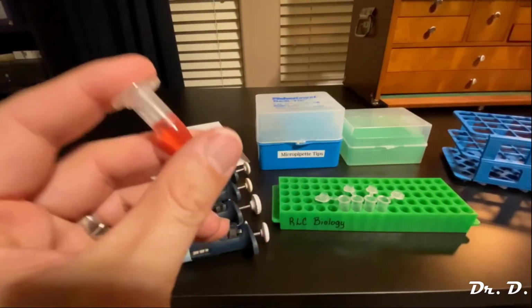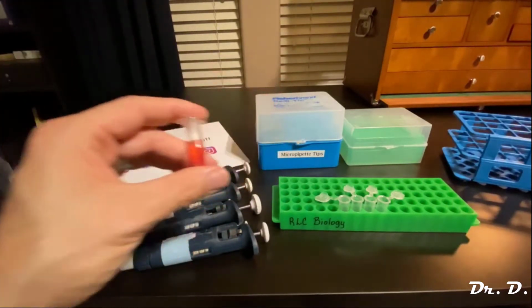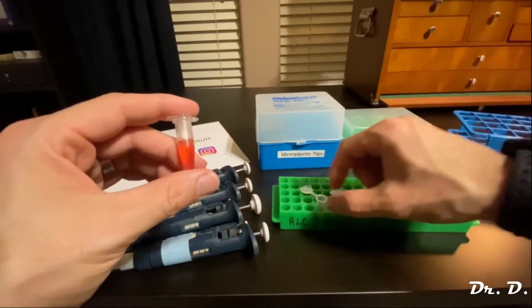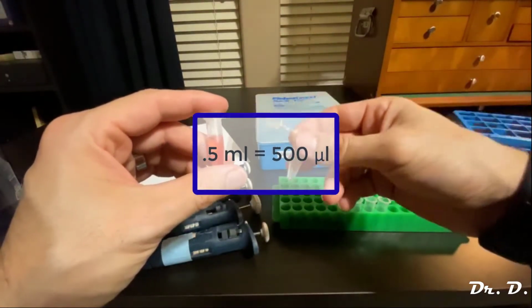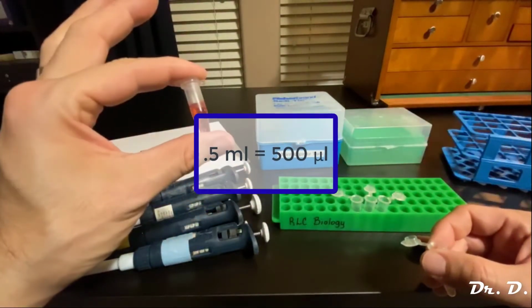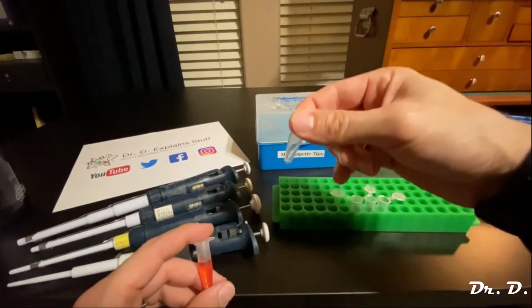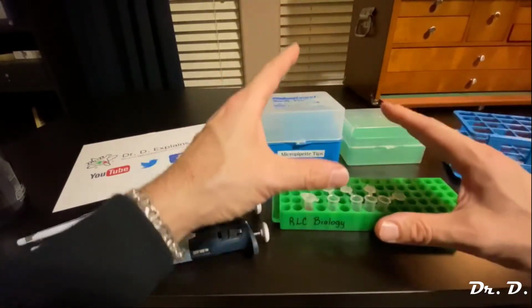Although be aware that these are actually called microcentrifuge tubes. So again, this is 1 ml of solution, and let's say I want to transfer 0.5 ml into here. So what would 0.5 ml be? 0.5 ml would mean 500 microliters. So 1 ml is 1,000 microliters. If I want to transfer 0.5 into here, that means I want to transfer 500 microliters into here. So how would I do that? Let's talk about that real quick.